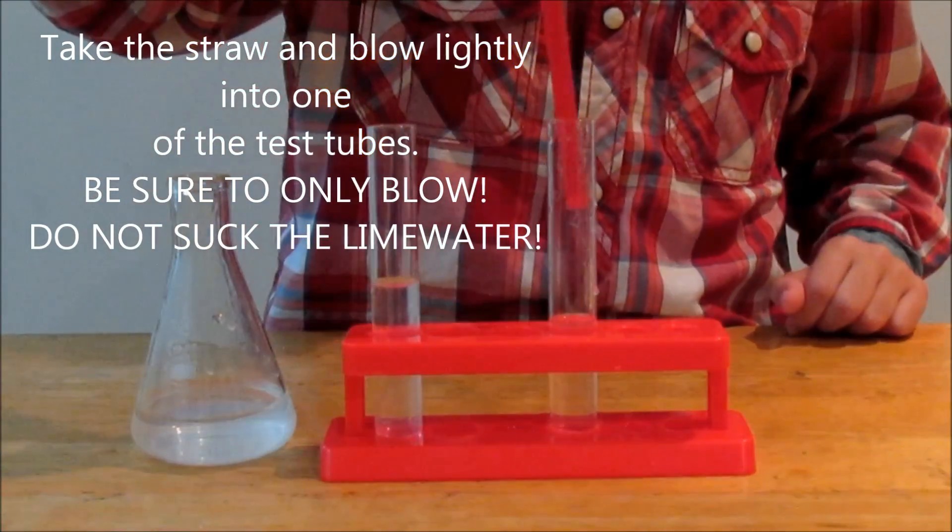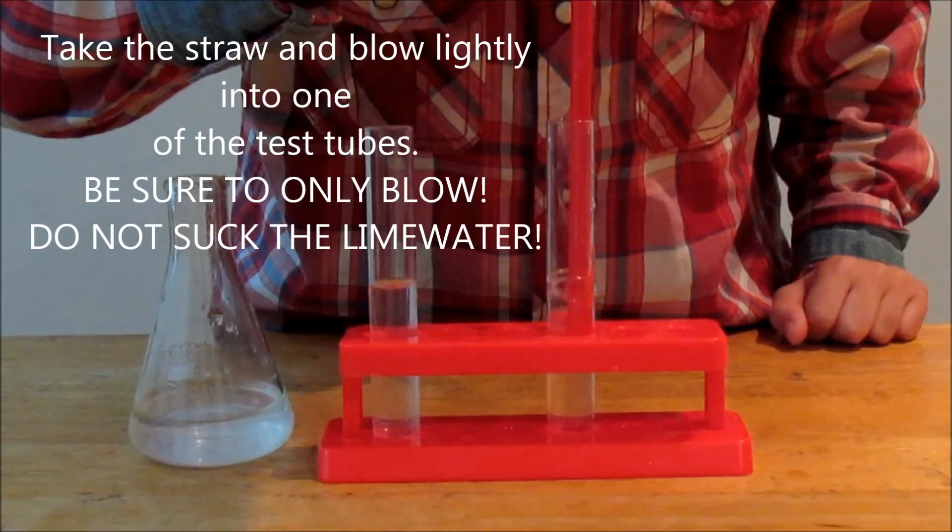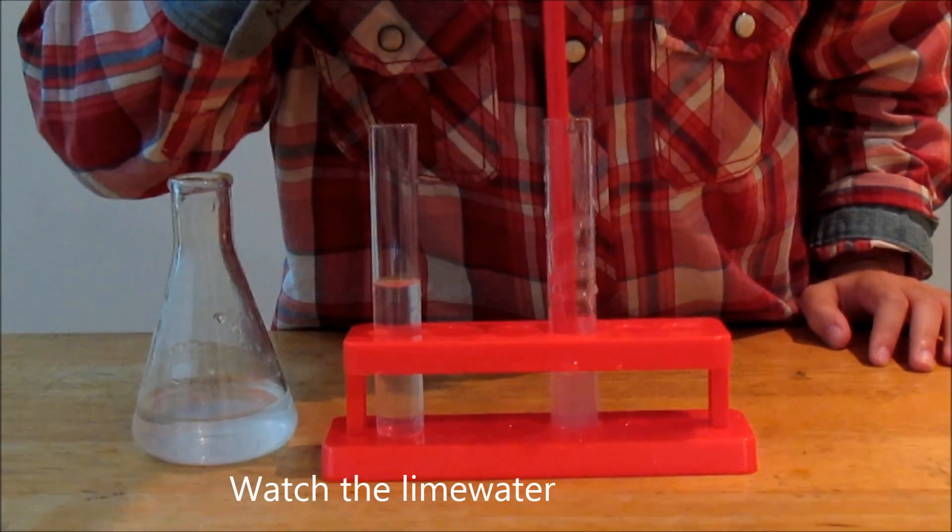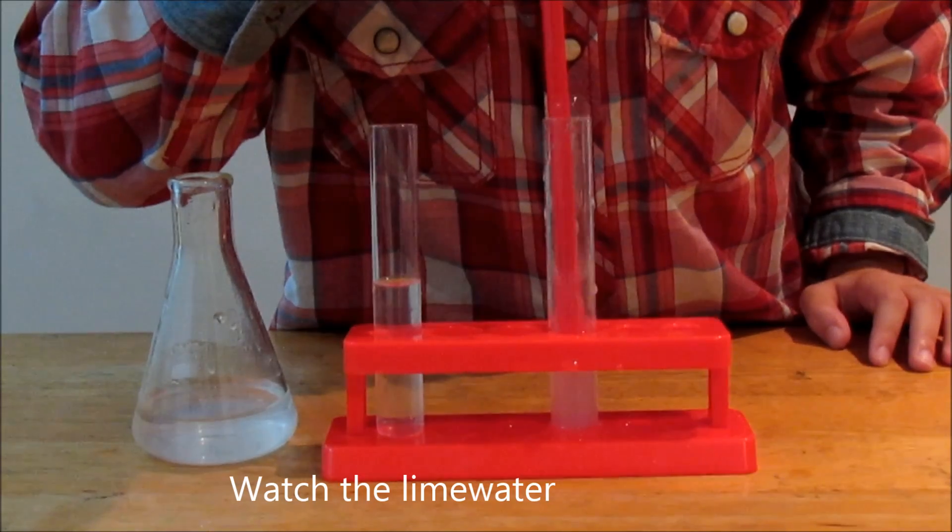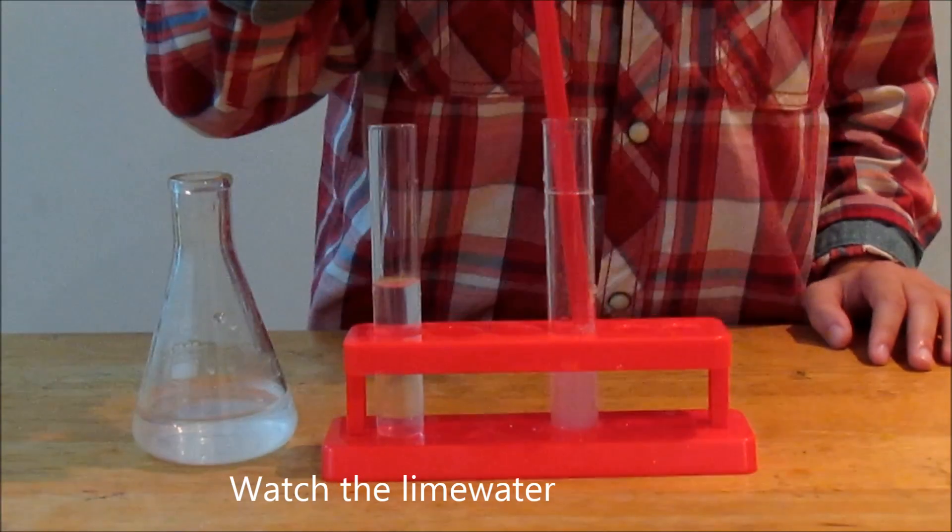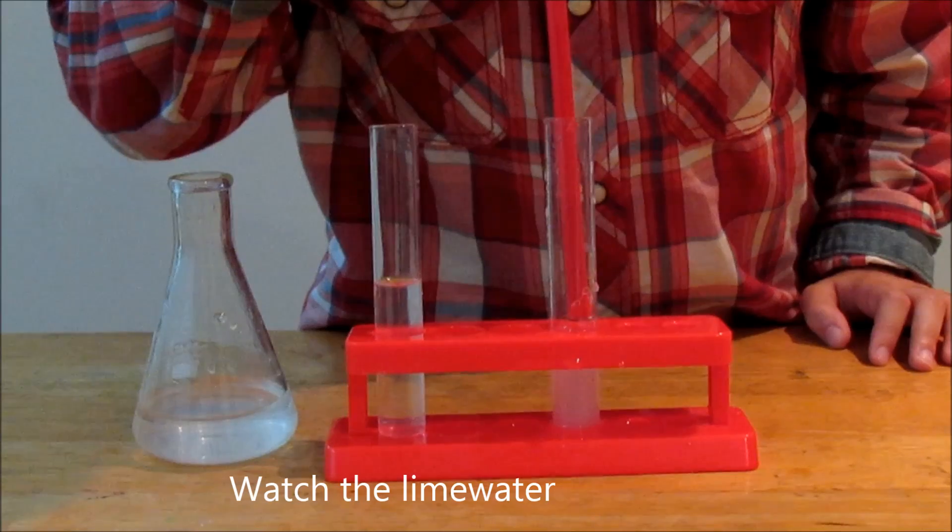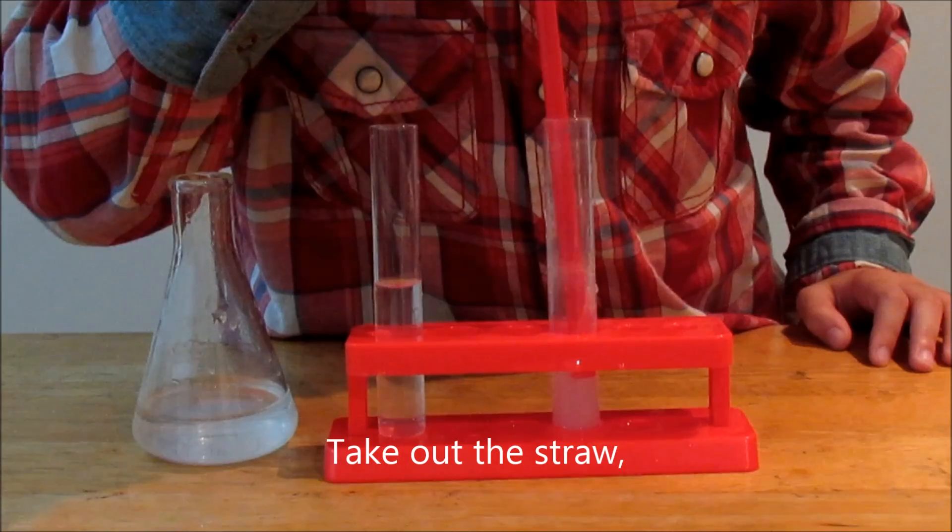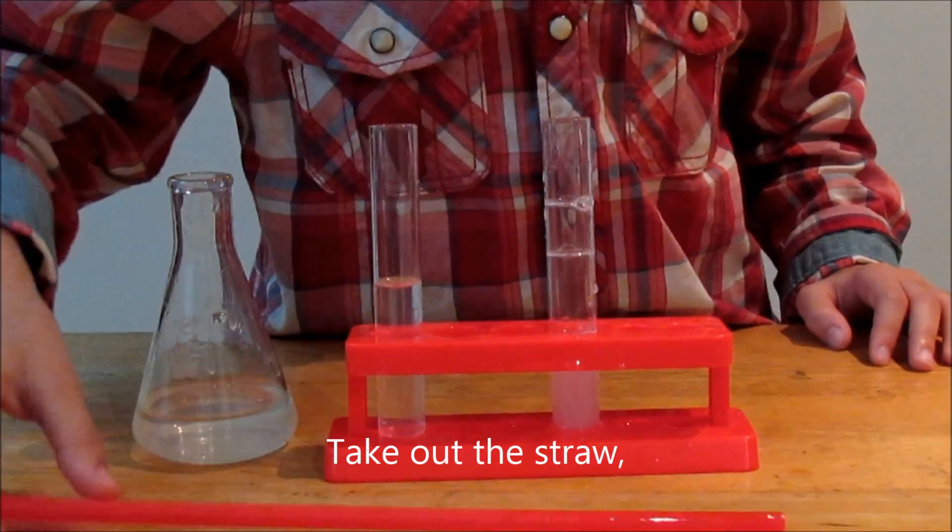Take the straw and blow lightly into one of the test tubes. Do not suck. Watch the lime water, then take out the straw.